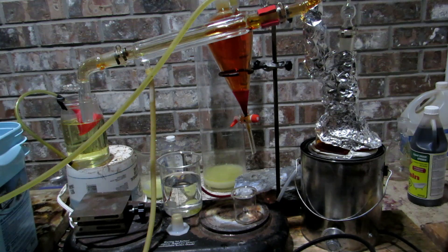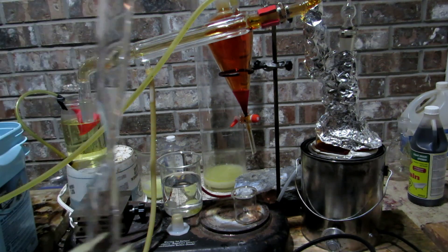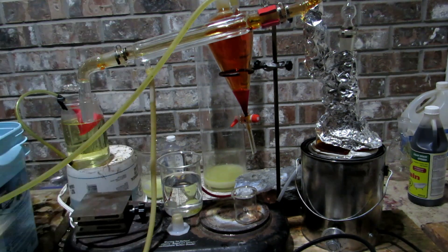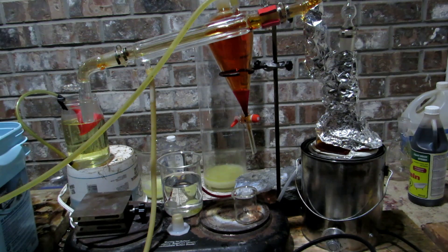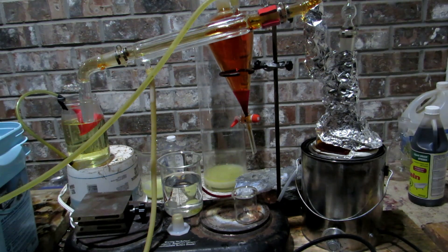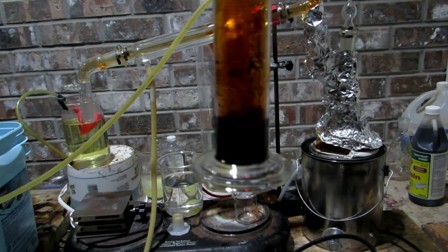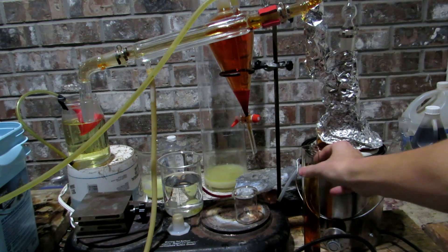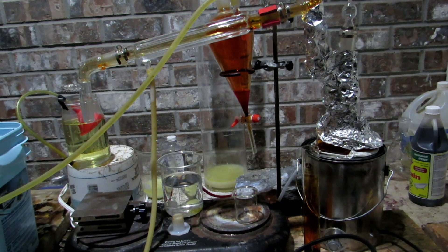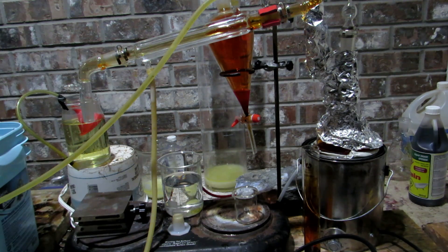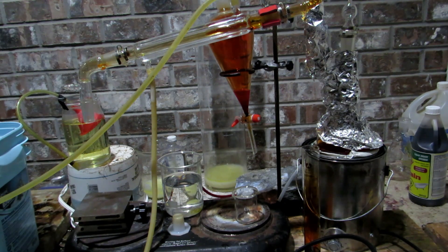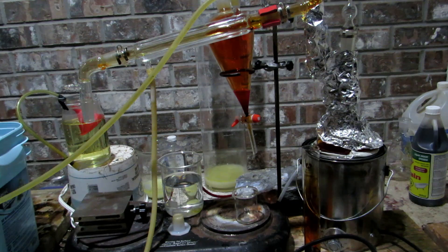I have prepared an ampoule here which is currently in this set of pliers and we'll just be adding the bromine into the ampoule and sealing it off. From what it looks right here we have exactly 11 milliliters of bromine. That's a decent yield. The 70 grams that we started with should have yielded around 15 milliliters of bromine so that's not too bad.